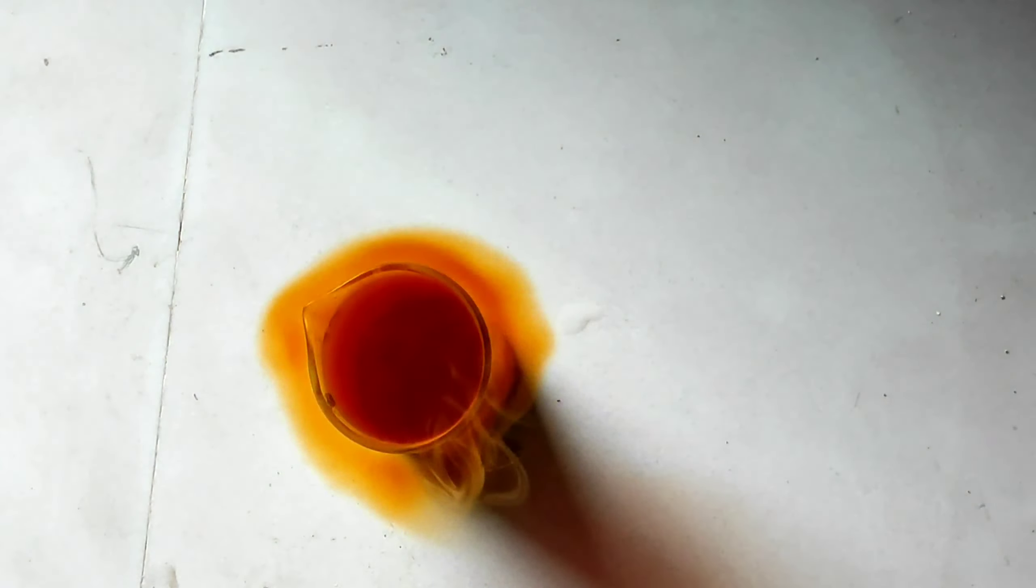You can see the gas of the brown color, which is very poisonous, which is nitrogen dioxide.